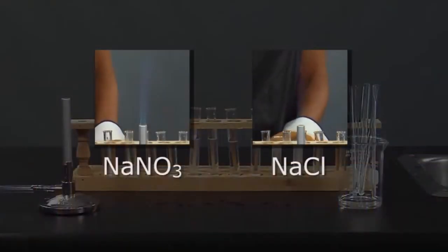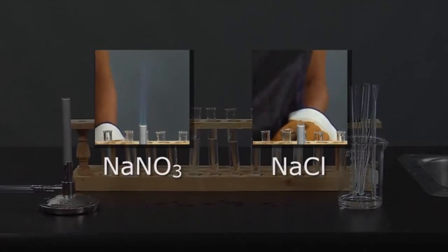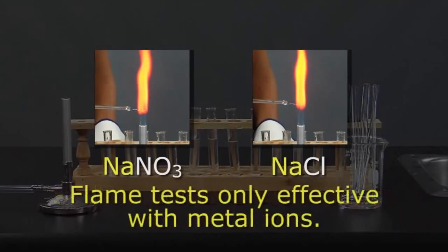Observe that the sodium compound has the same yellow color as the sodium chloride. If we tested other sodium compounds, the same characteristic yellow flame would be evident. We can conclude from this that every time sodium is present, it will produce a yellow flame. We also now know that the flame test works for metal ions, not other compounds, since changing the other ion present in the molecule did not affect the results. Let's continue with the other tests.